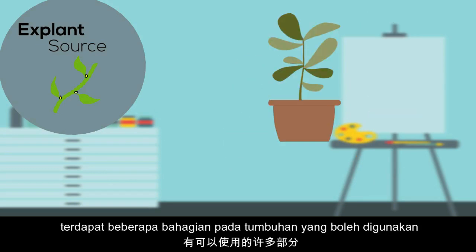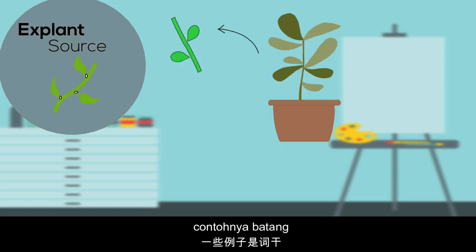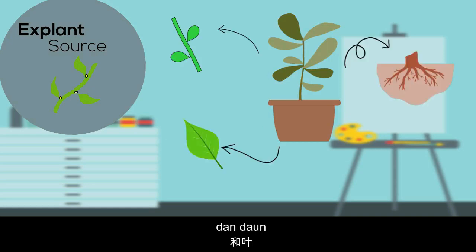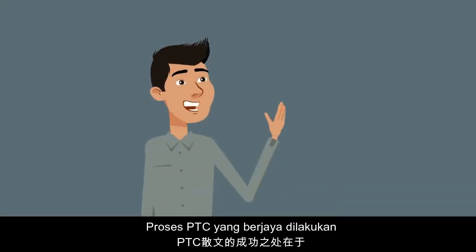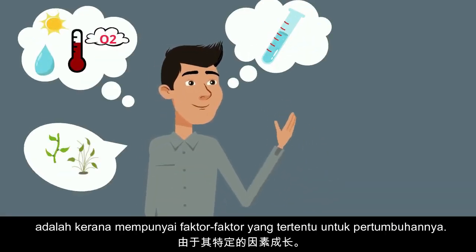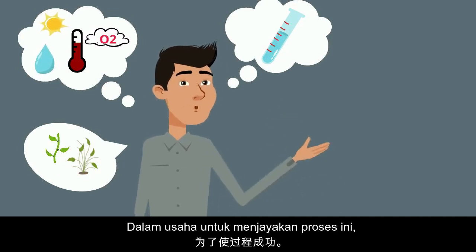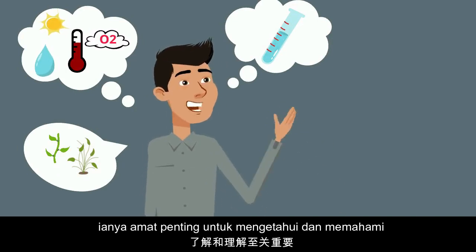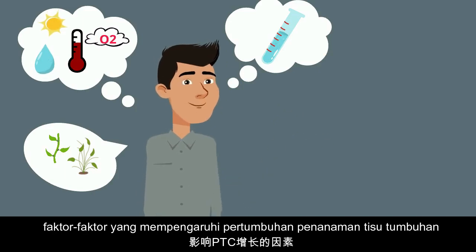There are many plant parts that can be used as explants; some examples are stem, root tip, and leaf. The success of the PTC process is due to these specific factors. In order to make the process successful, it is crucial to know and understand the factors that will affect the growth of PTC.